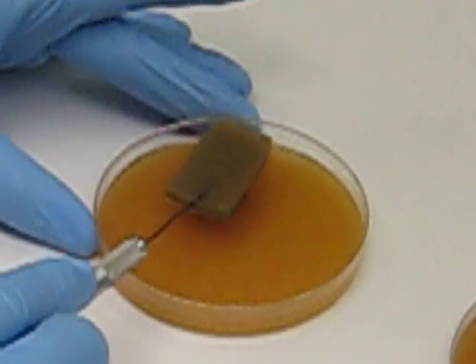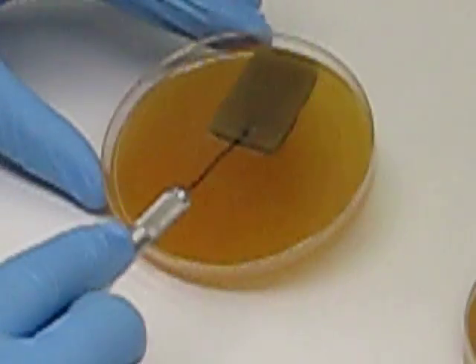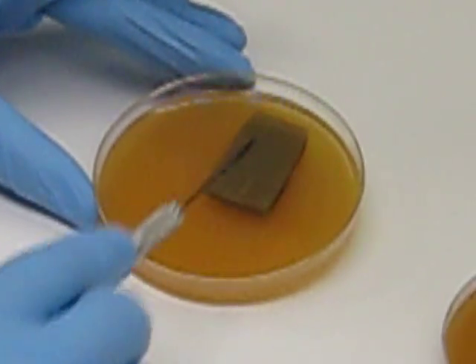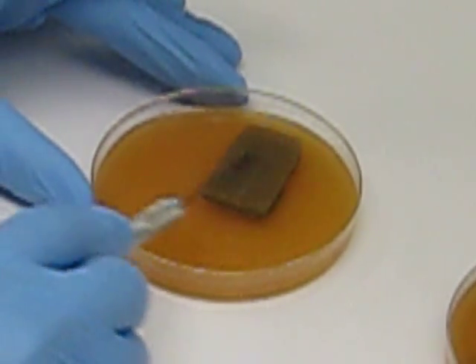And carefully, piercing as we did the first time, pick up the agar plug and place it on some new media that's not been subcultured on.